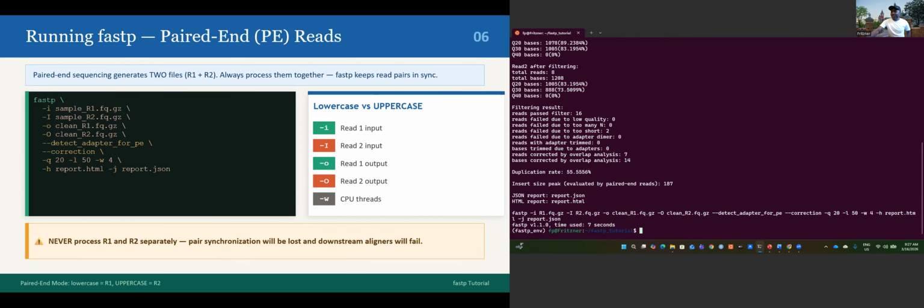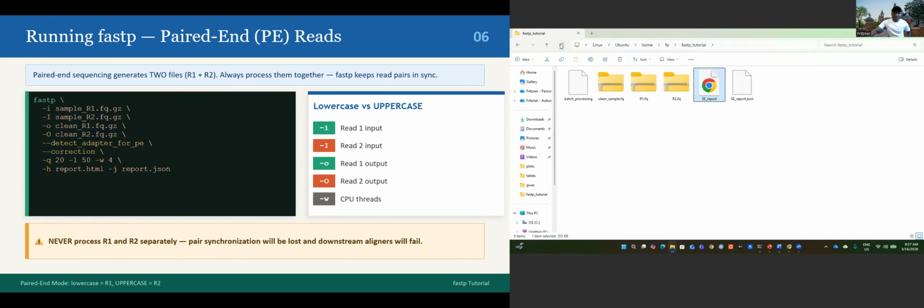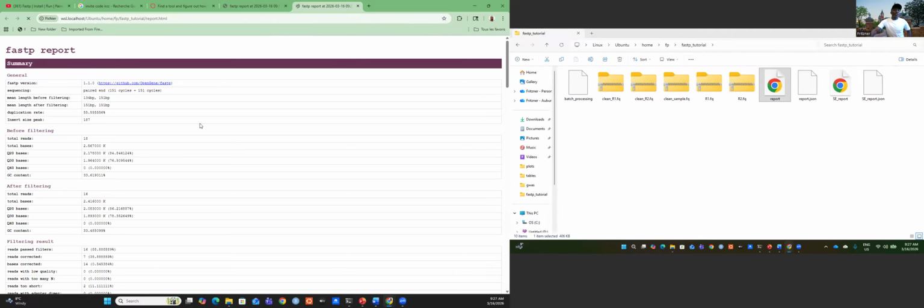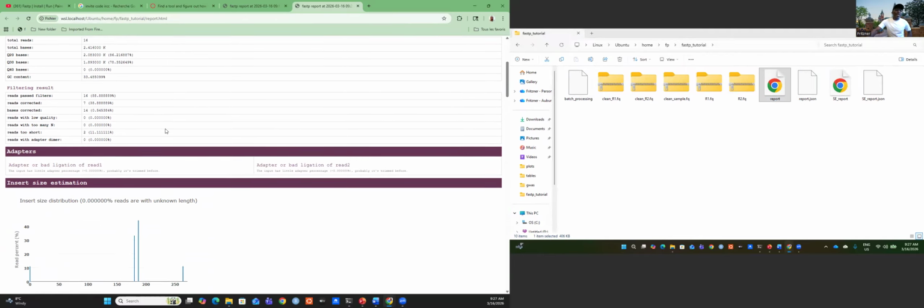It's the same if we go to the file manager, you will see, let's refresh. This is the report that we generated. It's a nice report. It's also interactive. You see, it's very different from the first one. You can click if I want only read one, or if I want all of the reads. It's pretty interactive, based on what you want.